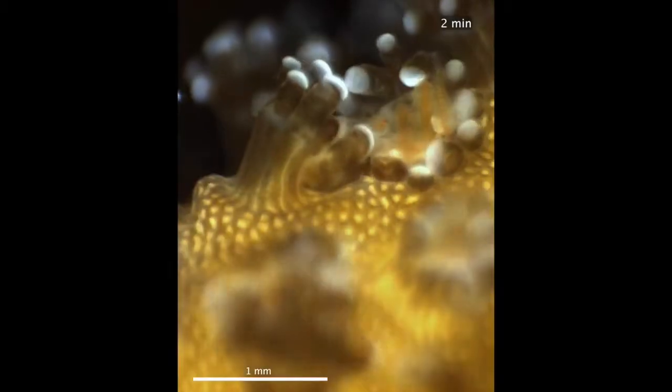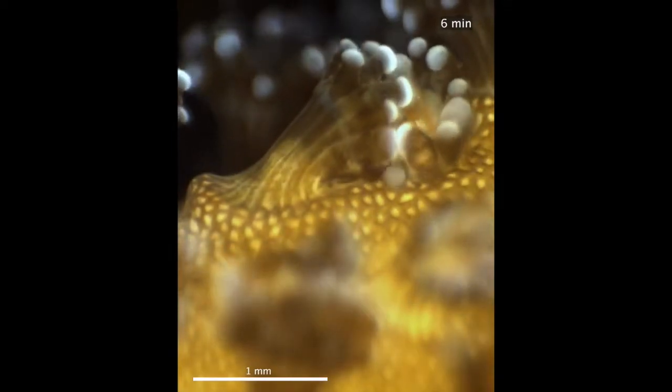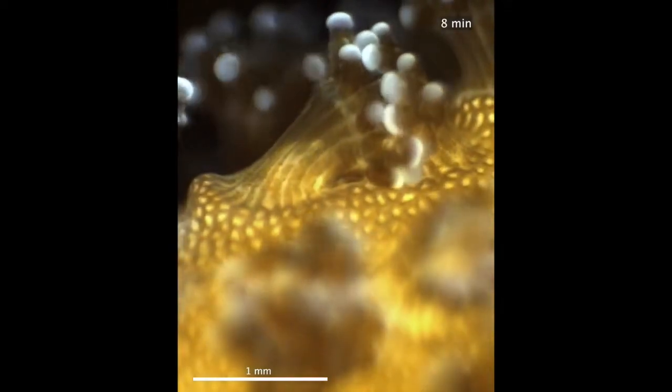My name's Andrew Mullen. I'm a PhD student at the Scripps Institution of Oceanography at the University of California, San Diego. My work focuses on designing instruments that operate in the ocean, specifically building systems to take microscopic pictures in the underwater environment. With the instrument, we were able to look at individual coral polyps and see their behavior and competition with other types of corals.